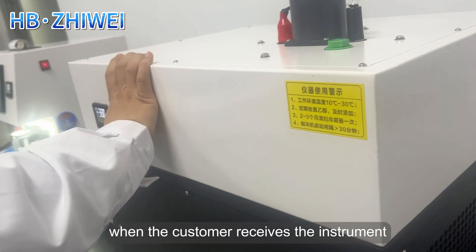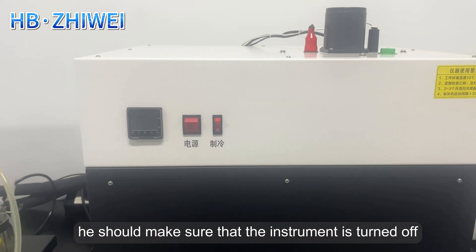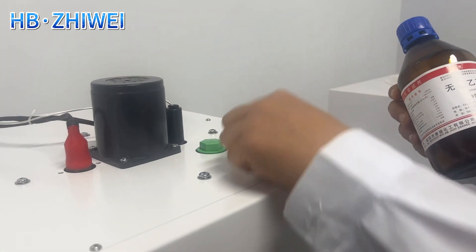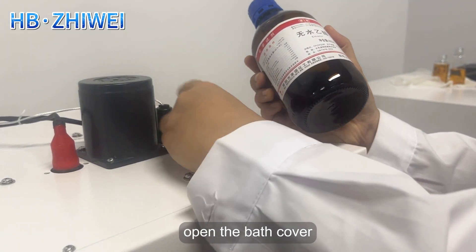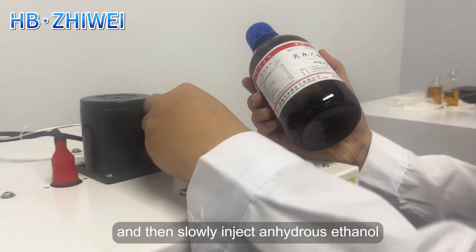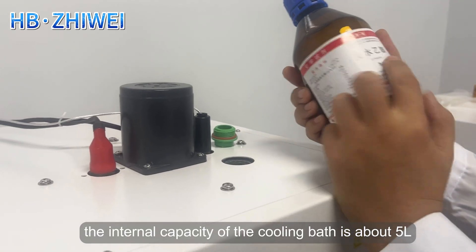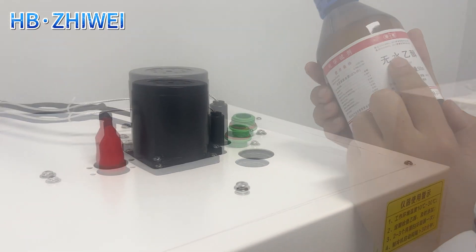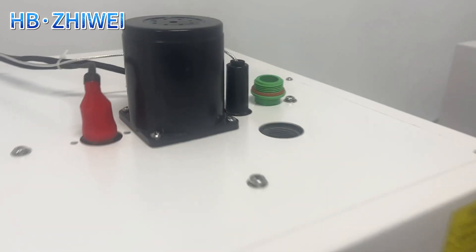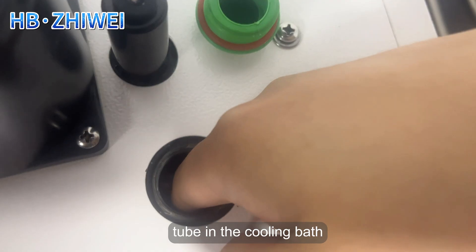When the customer receives the instrument and uses it for the first time, make sure the instrument is turned off, open the bath cover, and then slowly inject anhydrous ethanol. The internal capacity of the cooling bath is about 5L. Fill it until the anhydrous ethanol is above the height of the copper tube in the cooling bath.